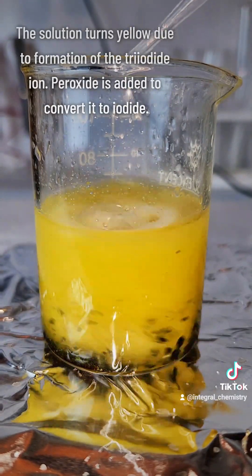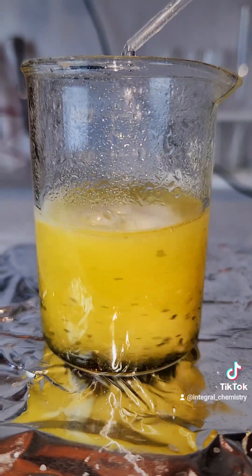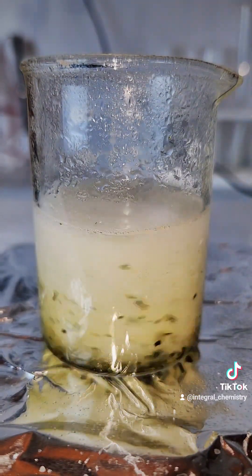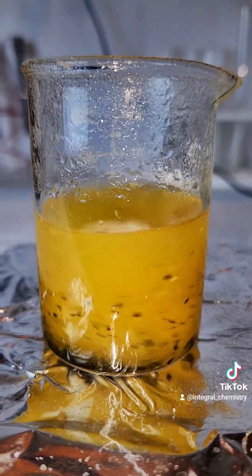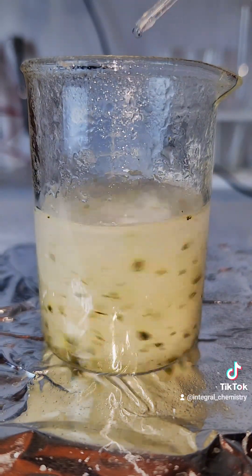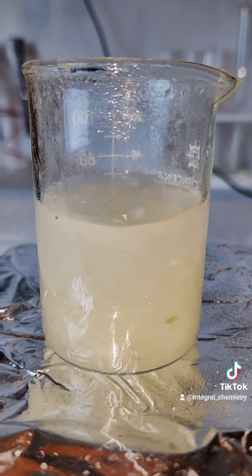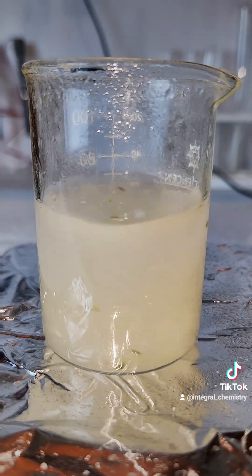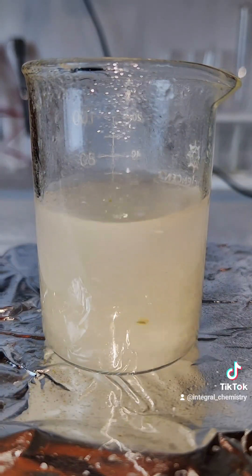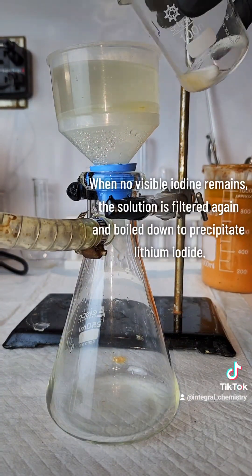To get rid of the triiodide and favor the formation of my product, I add hydrogen peroxide until the solution clears up. When the solution goes clear, it means all of the iodine has been used up and the reaction is complete. At that point, I pass the solution through vacuum filtration to remove any small pieces that might be remaining. This is because lithium iodide is extremely soluble in water, so any small pieces left over can't be lithium iodide.